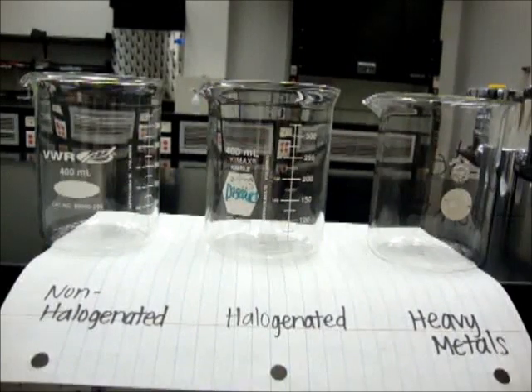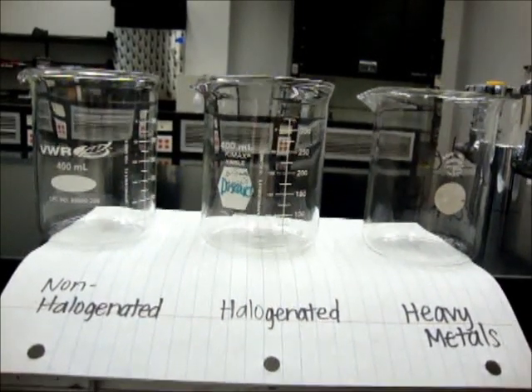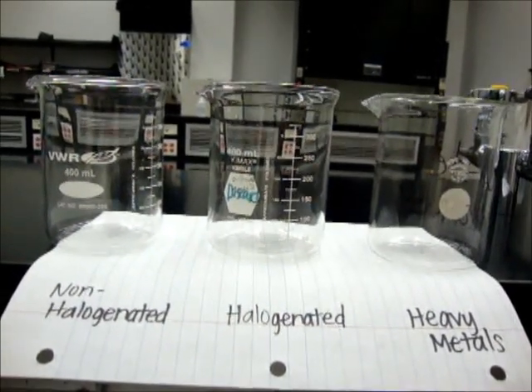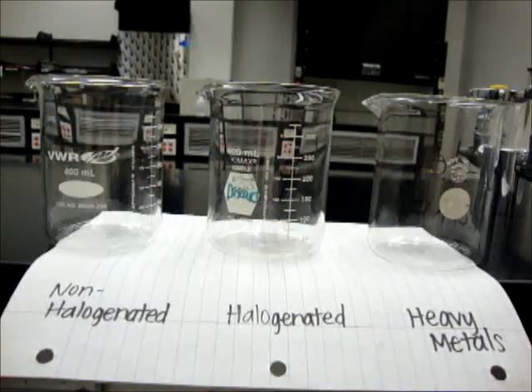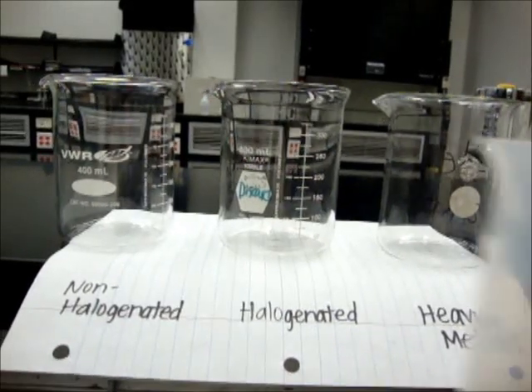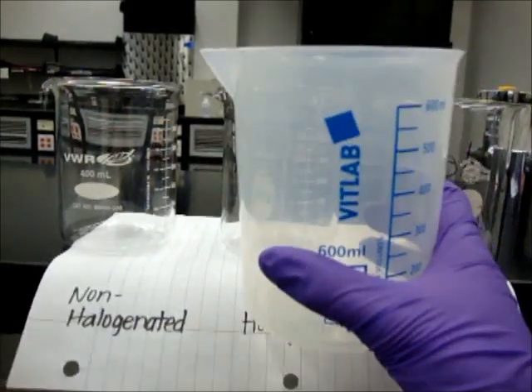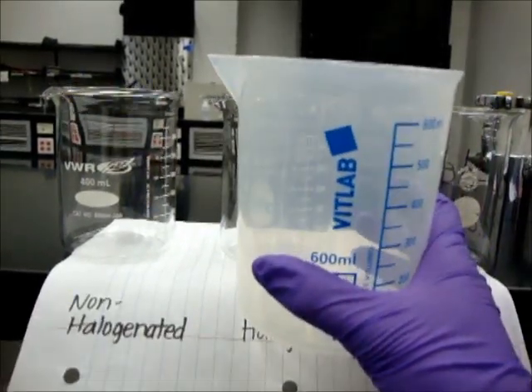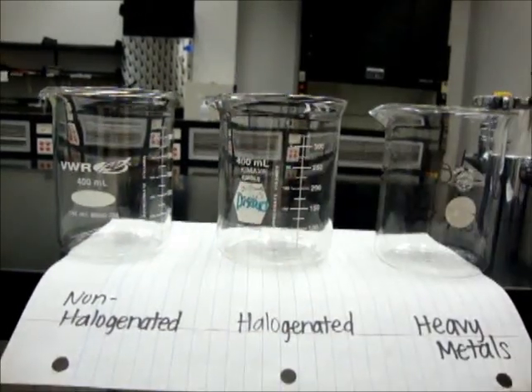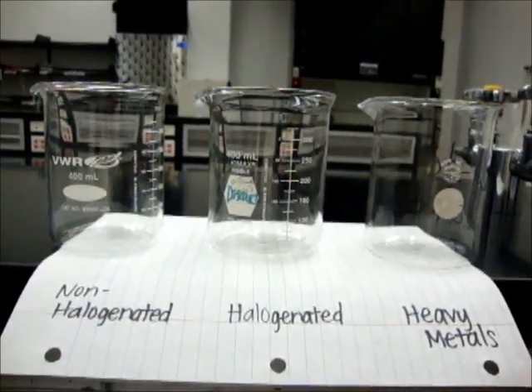And if you're ever unsure of what beakers contain what reactants, then you can combine them in a large beaker and dispose of it in the heavy metals waste. But if you've labeled them, then it shouldn't be a problem.